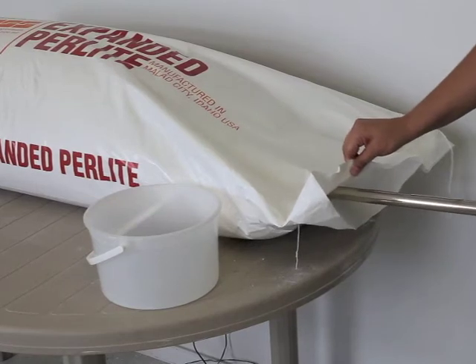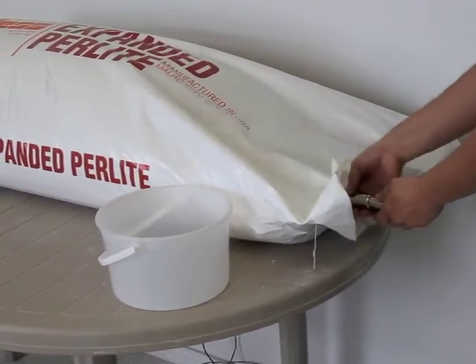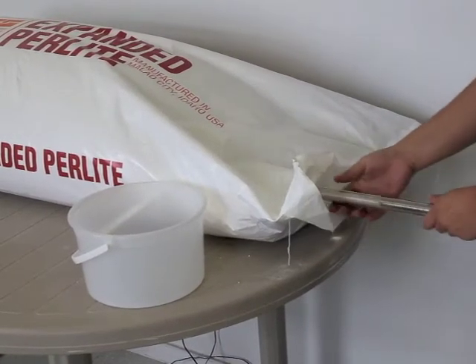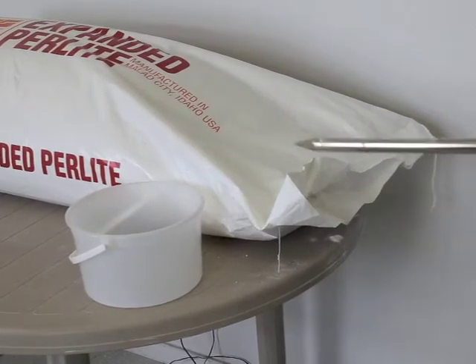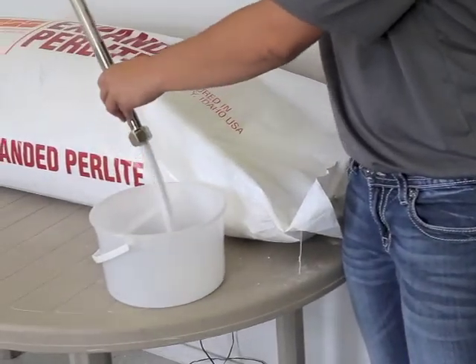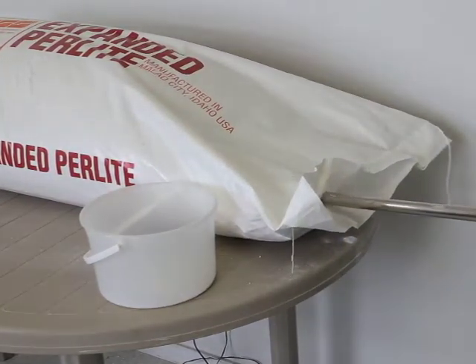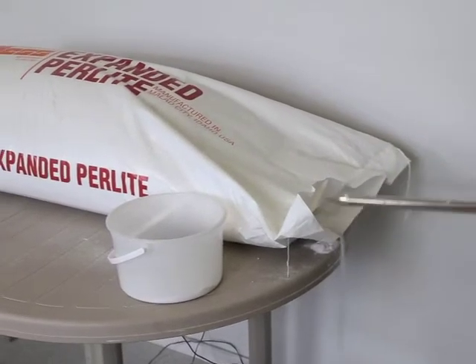Representative portions from each bag selected shall be secured by means of a suitable sampling grain-thief tube. The sampling tube shall be inserted the full distance between diagonally opposite corners of the bag, with the bag lying in a horizontal position. The portions obtained shall be combined to produce a composite sample having a volume of at least 8 gallons or 30 liters. At least one composite sample shall be prepared and tested separately for each 2000 bags of perlite.